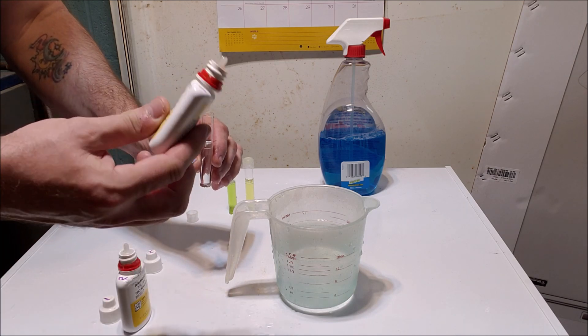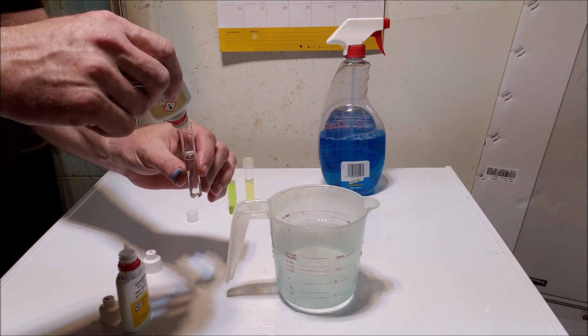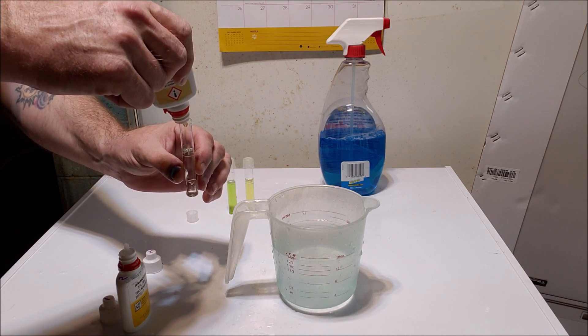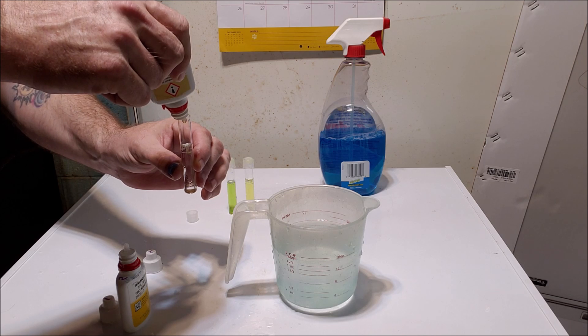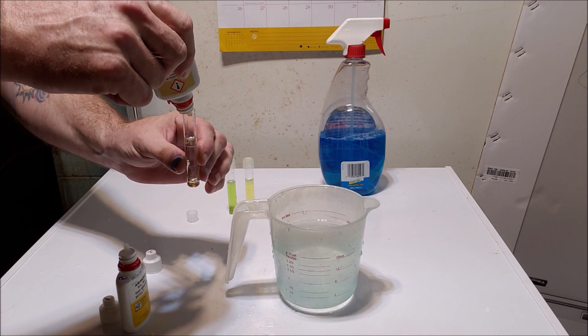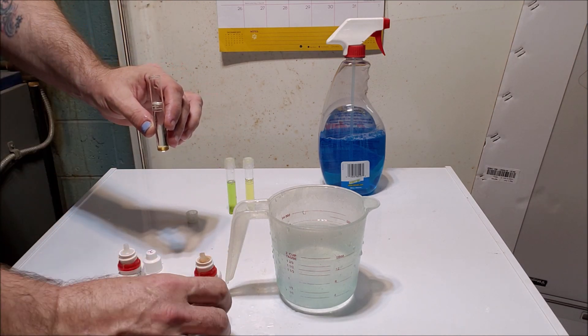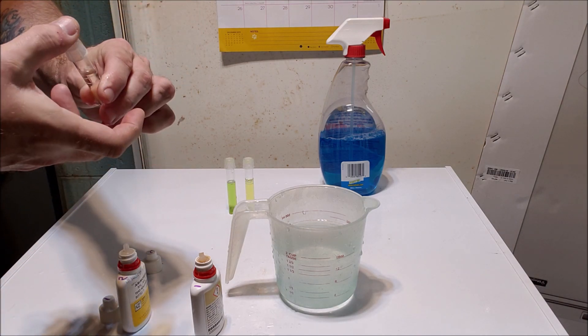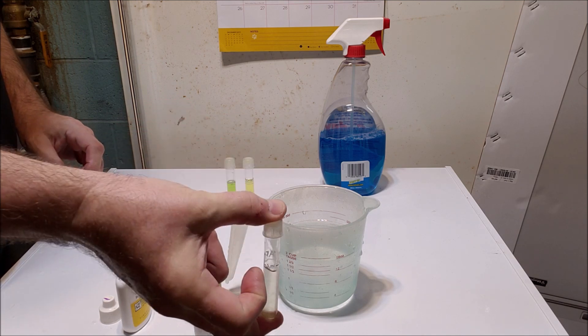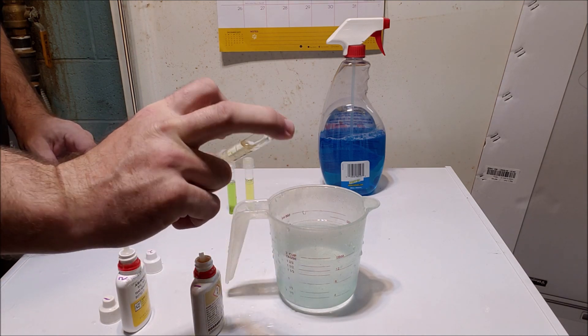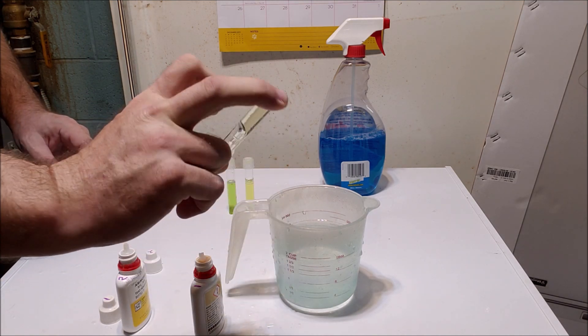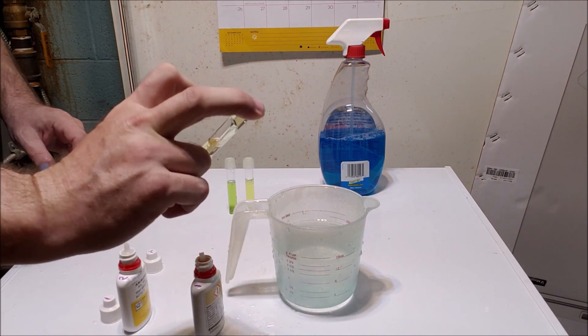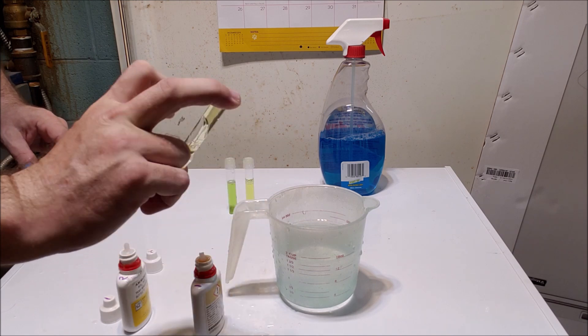Now, without shaking it, we're going to put reagent number one in. And now, we're just going to rock it back and forth rather than shaking it vigorously.